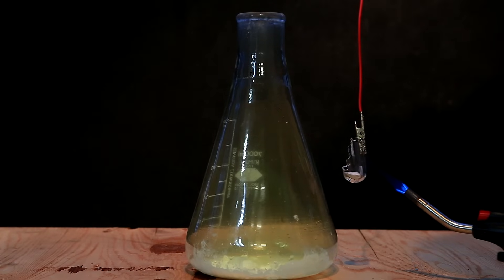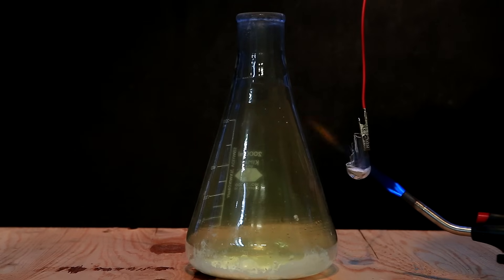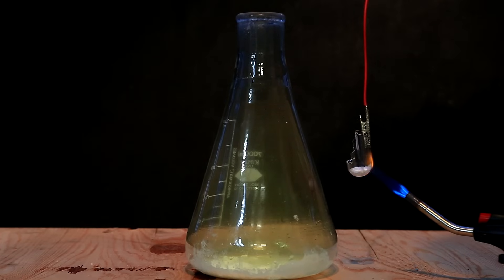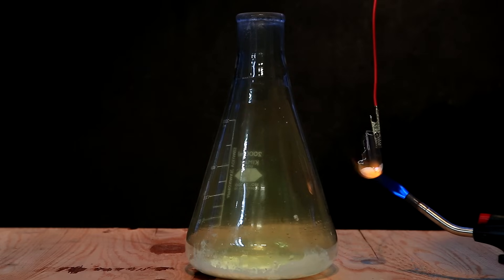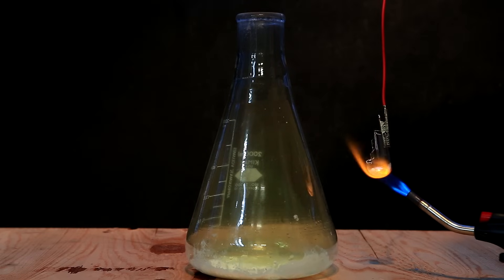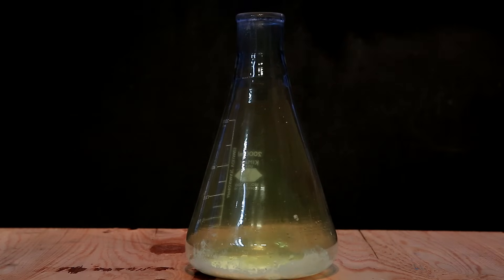To lower the sodium in, I made somewhat of a ghetto little contraption, which involved a broken test tube and an alligator clip. The sodium was placed at the bottom, and then using a torch, I melted it. I heated the sodium until it ignited, but when I lowered it into the chlorine, it went out, which was quite surprising for me actually.